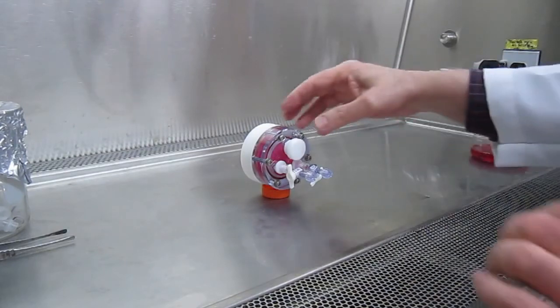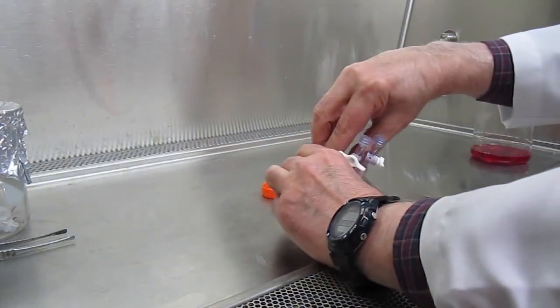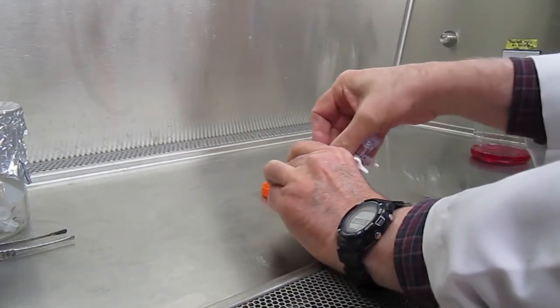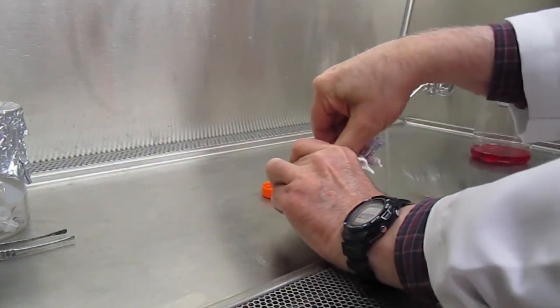After the cells have sedimented, you open the fill port, making sure not to disturb the cell pellet at the bottom.